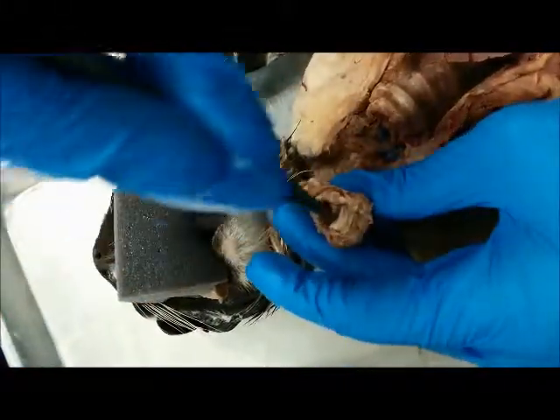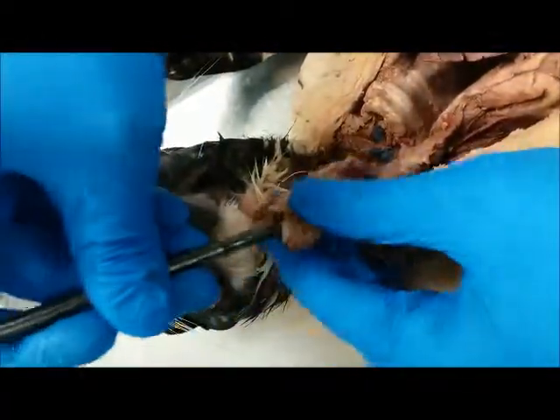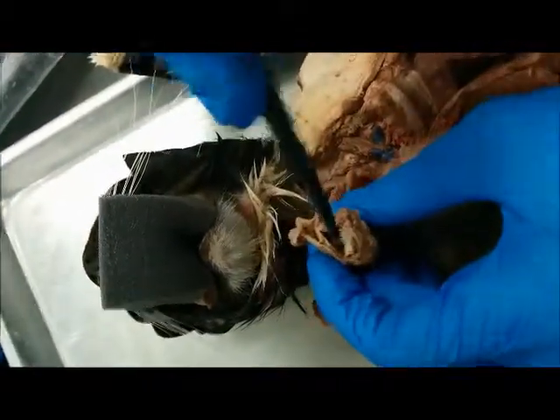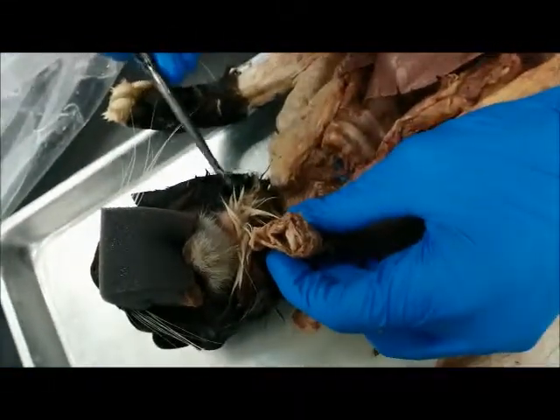So I made my way through the esophagus. Now I'm trying to make my way through the trachea. Right here, I made my way through the trachea. You can see the probe moving through the C shape right here, the trachea. And the reason why that's possible through one hole, for me to go into the esophagus and trachea, is because we have something called the epiglottis.